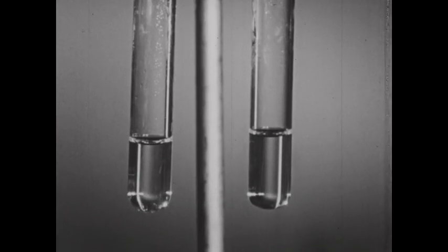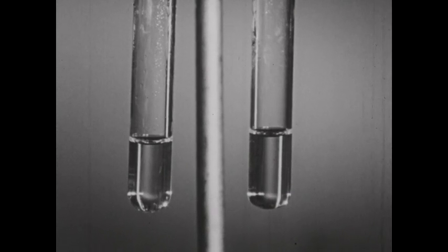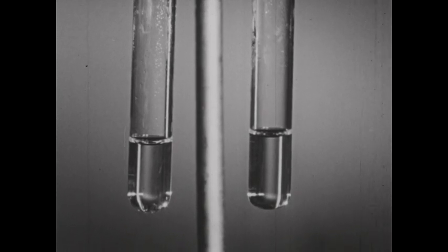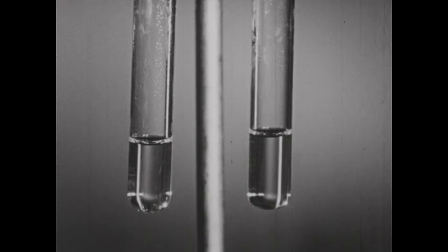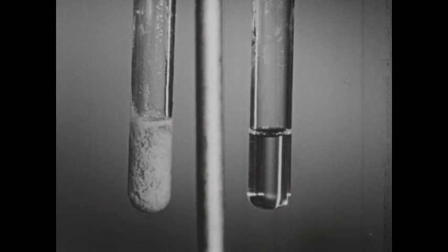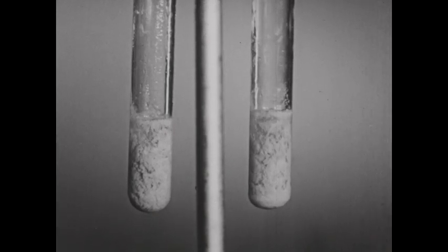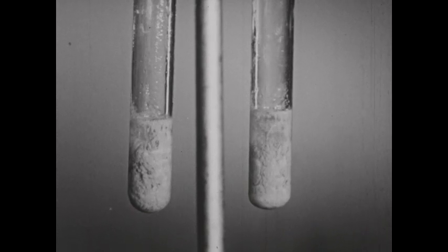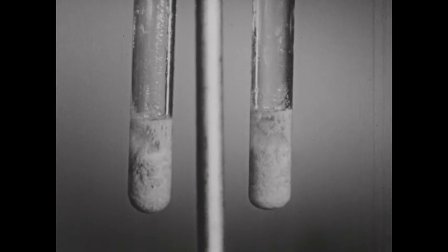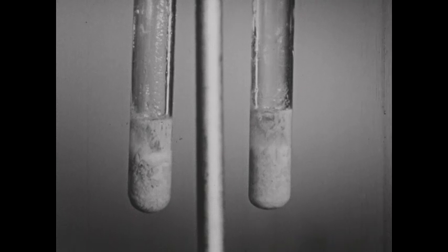We turn now to a consideration of some reactions of the phosphate ion. In each of two test tubes, several milliliters of a solution of sodium phosphate have been placed, and to each tube, a few drops of silver nitrate solution are added. The yellow precipitate that forms is silver phosphate.